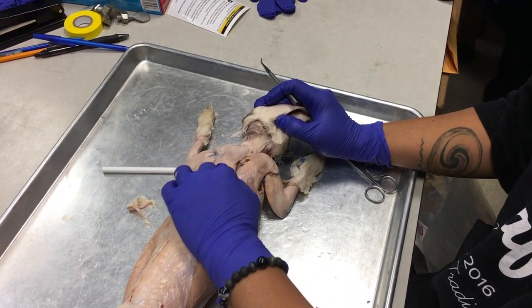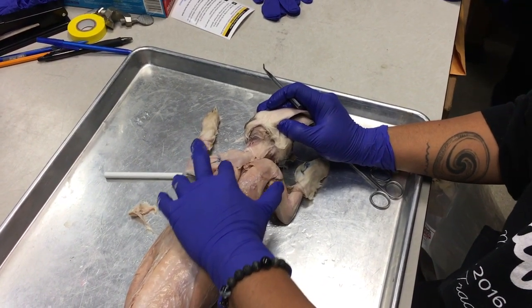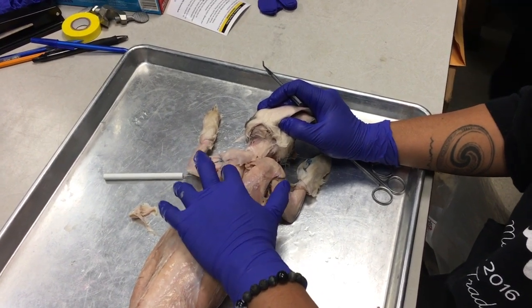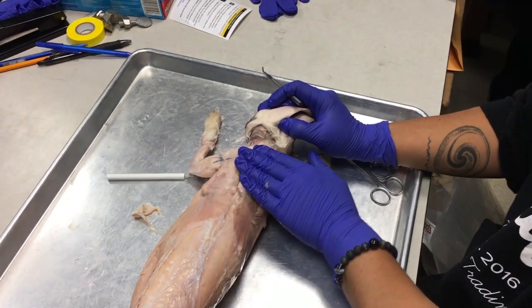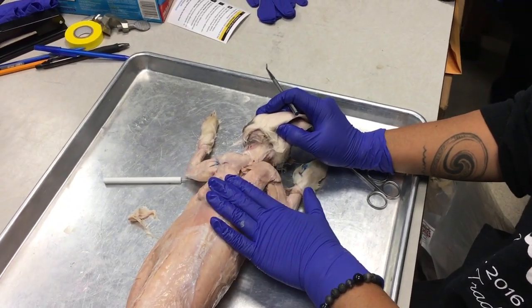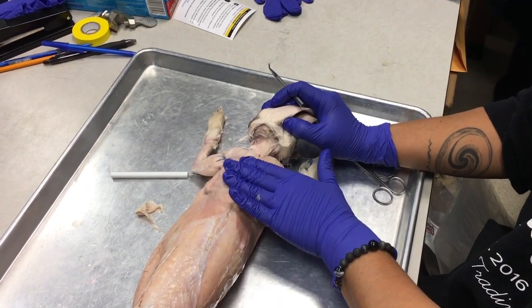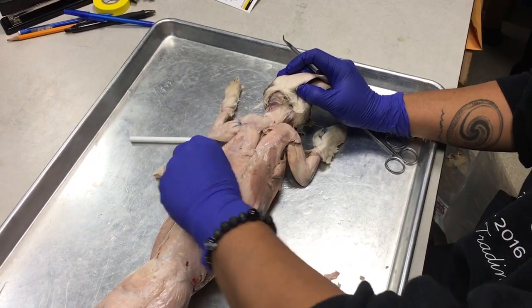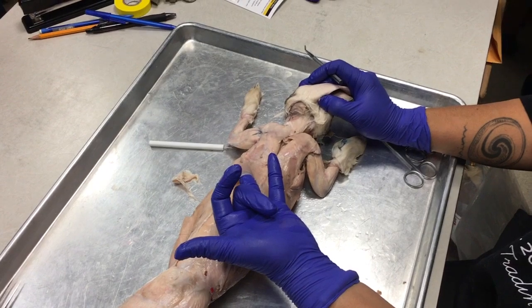And then if we move back and you press down on the bunny's shoulder, you're going to feel the spine of the scapula or the shoulder blade. Okay? And on top of that shoulder blade, the sheet of muscle is called the spinodeltoid. Okay? So we have our clavodeltoid, spinodeltoid, and then further posterior, this big thin sheet of muscle here, that's called the latissimus dorsi.